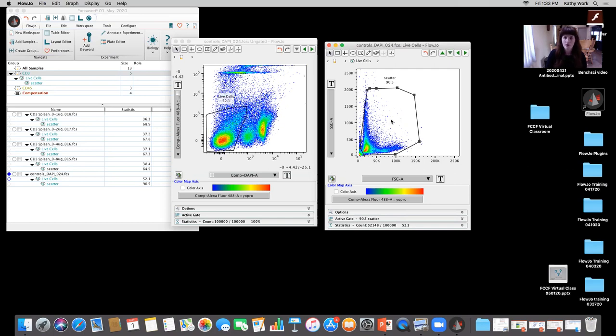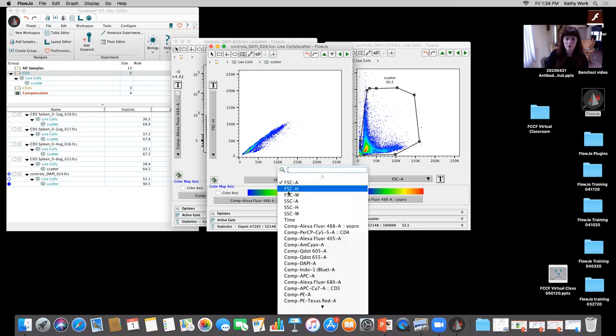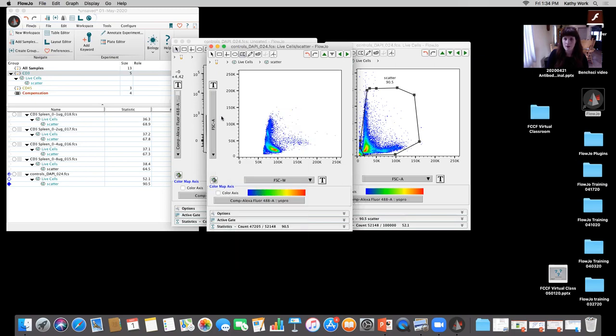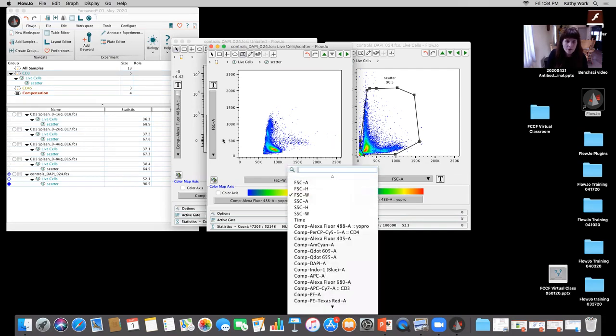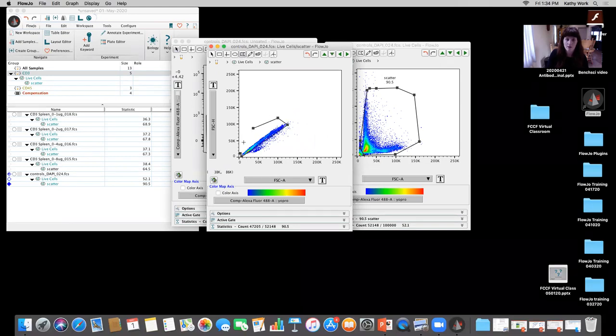So from there, I'm going to open up scatter. I'm going to do a singlet gate, and I'm going to look at forward scatter area by forward scatter height for this. Now, what I mentioned earlier was that the area will be a little bit bigger than the height if we're looking at those two parameters, or if I'm looking at forward scatter area and width, those are also some aggregates right there because the width and the area are impacted as you have two cells going through the laser beam at the same time because they're aggregates. Okay. I typically suggest that people scroll through all the different options and see what best fits their data. For this, I think that the height and area is okay. I'm going to call those my single cells.